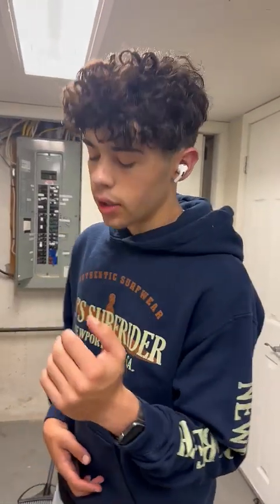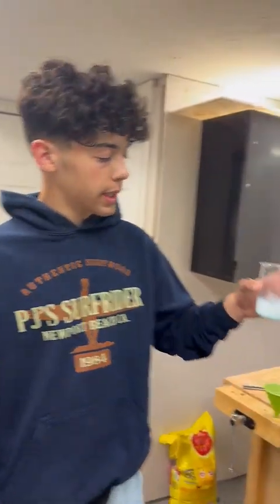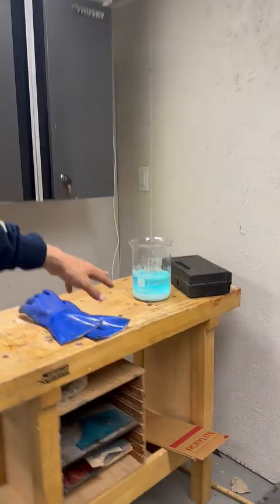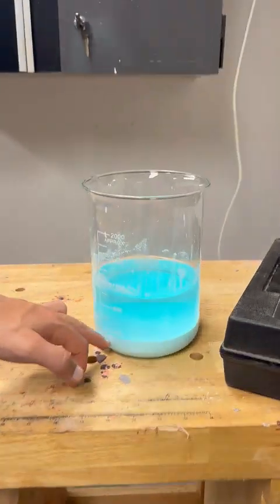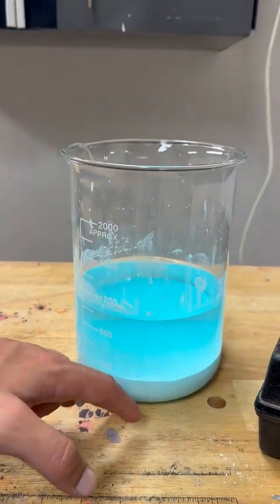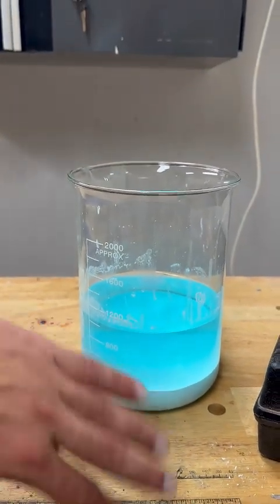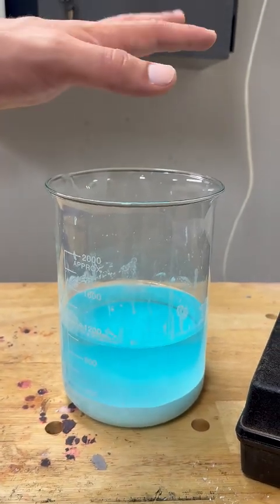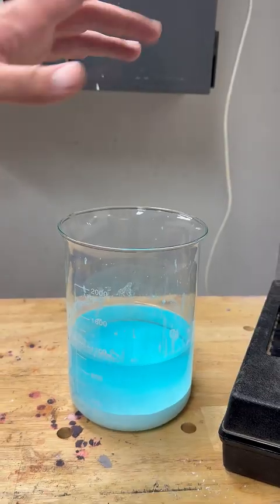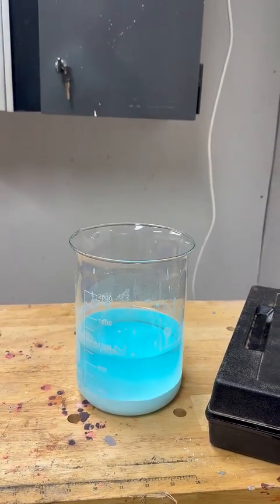So I got some stuff, and I'm going to go up to the garage and driveway actually, and try to distill it. I did this last night, and I have let it set, and all of the copper oxalate I let settle to the bottom. But if I touch barely any of this, like even lift it up, it will all mix out. And I really don't want that because it kind of gums up my distilling, I found out yesterday.